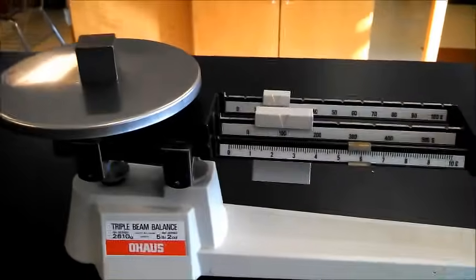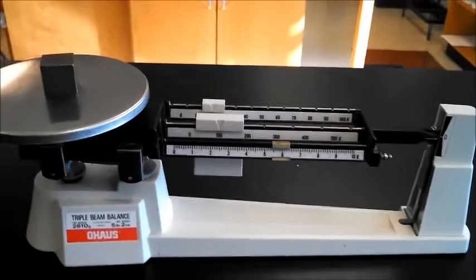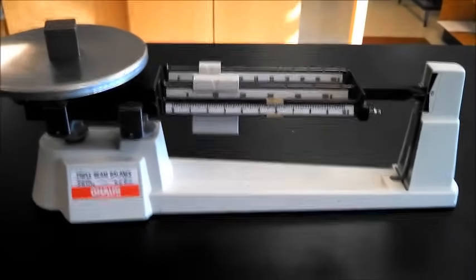Now, that's the basics on how to use a triple beam balance. Make sure you practice a lot so you know how to use this instrument.